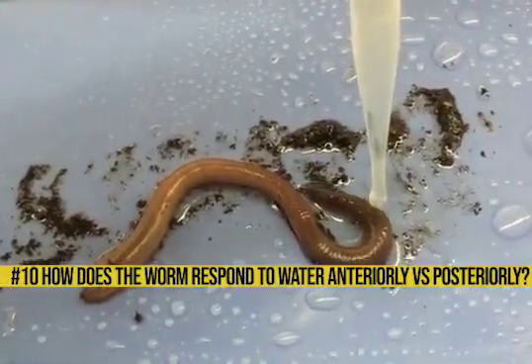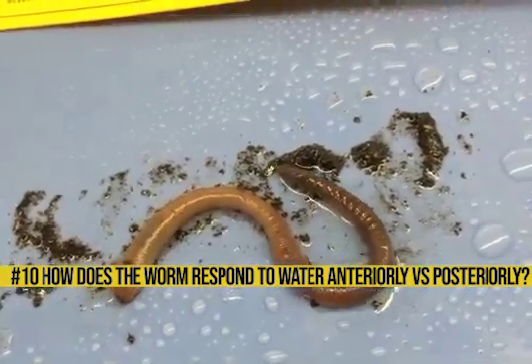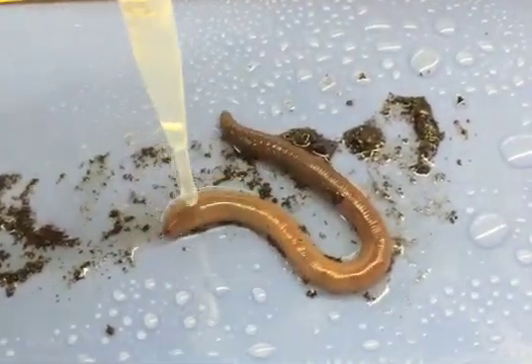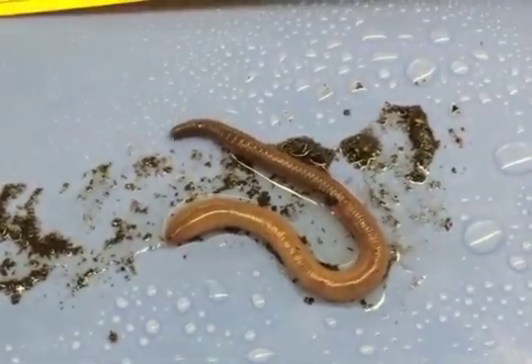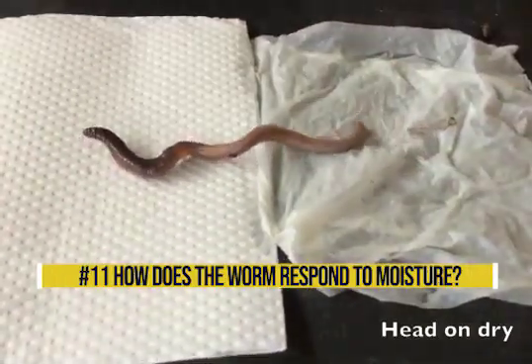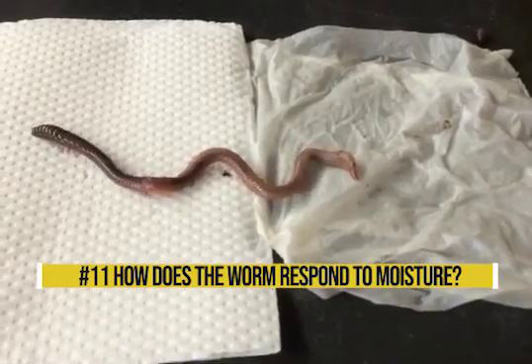Number ten: how does the worm respond to water, anteriorly versus posteriorly? Record the data into your data table. Number eleven: how does the worm respond to moisture? Record this data in your data table number one.